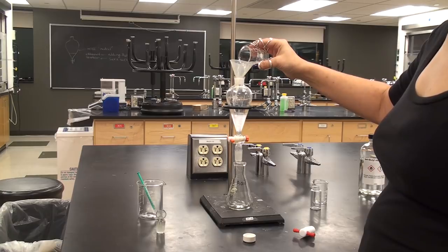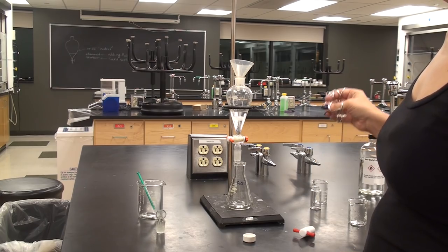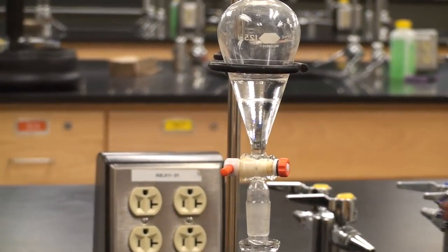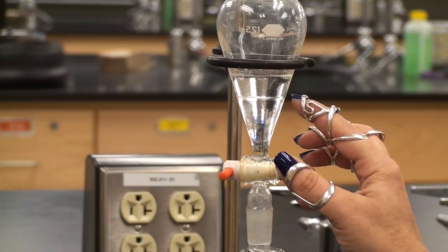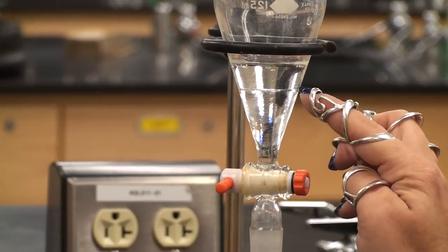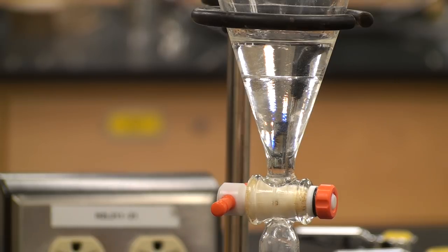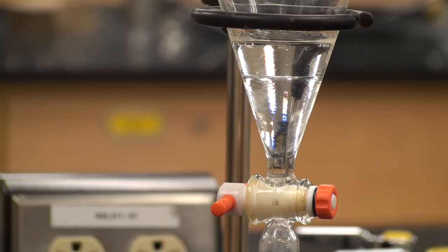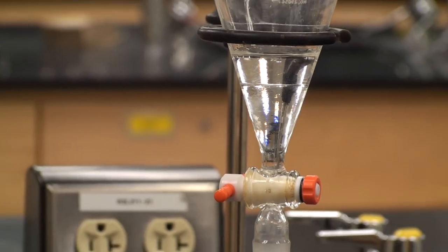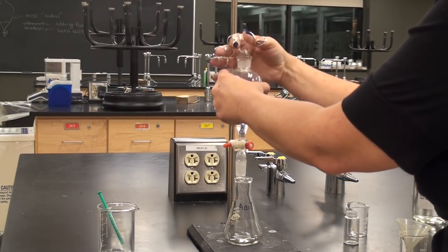Next, add 15 milliliters of 5% sodium carbonate in water. You can see right away that two layers form immediately: the bottom portion is the aqueous layer — the sodium carbonate solution — and the top portion is the methyl tert-butyl ether. However, simply pouring the sodium carbonate through the MTBE is not going to allow all of the acid to react with it, so we need to mix them thoroughly using the stopper.